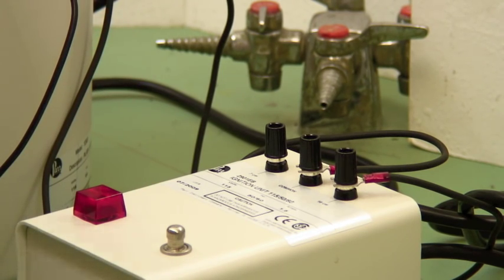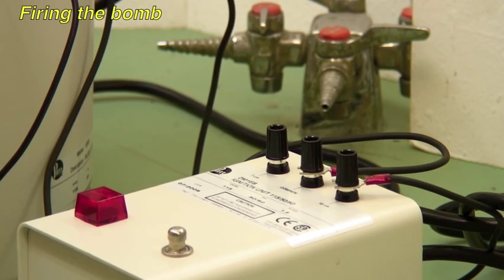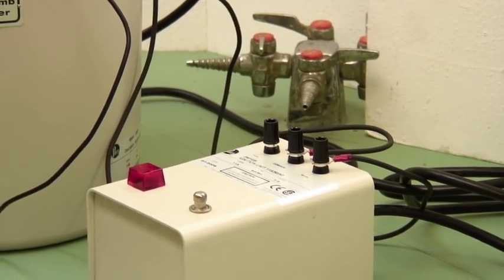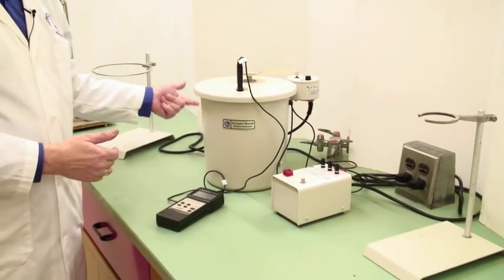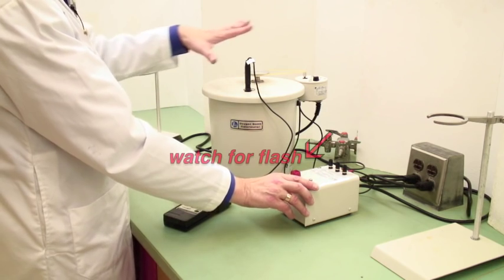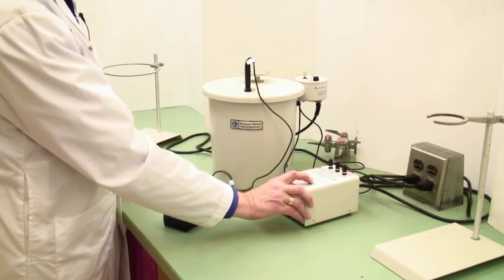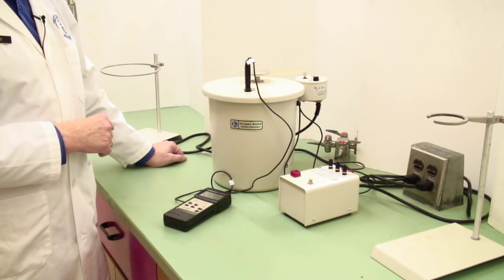Now we'll assume this is 21.49. We'll assume we've waited for five minutes. You need to be taking notes of time and temperature. Have one of your number with a table preset ready to go at T0, 30 seconds, 60 seconds, 90 seconds and so on. Ready to fire. Don't put your head over anything because if it does go, it's going to go straight up. Push the button and we got a light flash and it disappeared again. So the fuse wire has burned through rather.